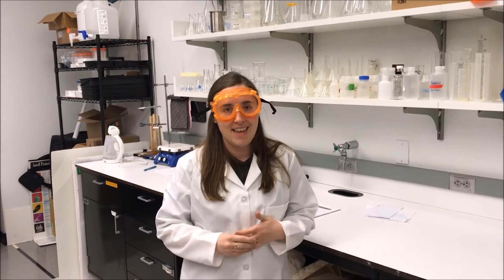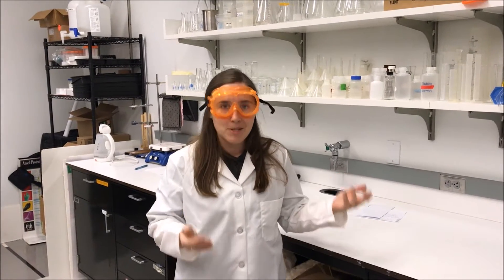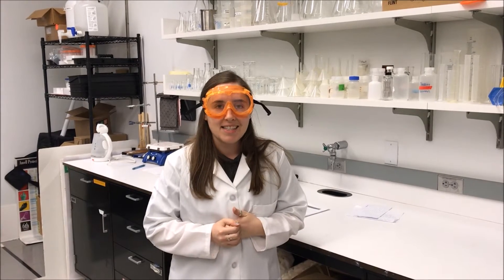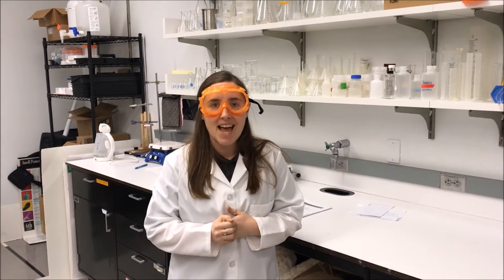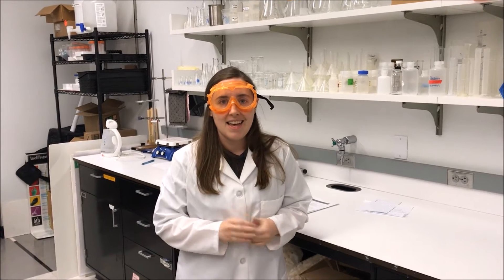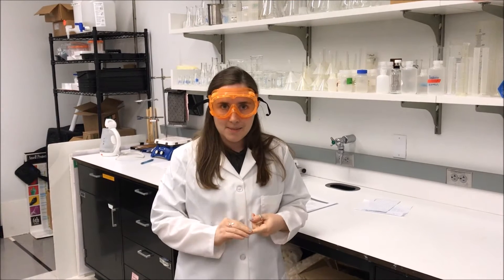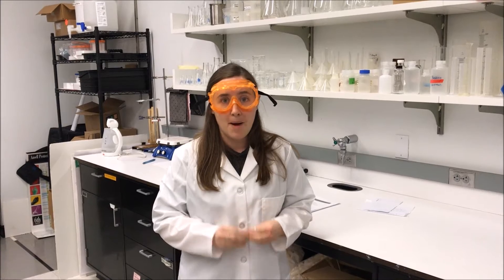As a teacher, you only need to prep the greener, safer reagents because you're not actually going to have them do the other one. In the next couple of videos, Marissa and Lavinia are going to be walking you through the single displacement, double displacement, and decomposition reactions from our lab.